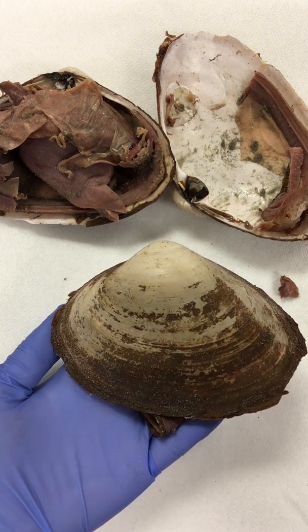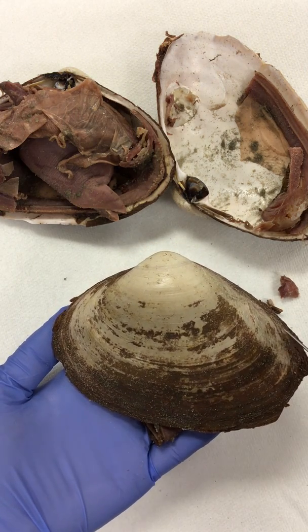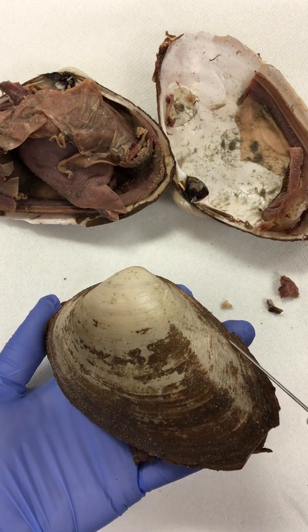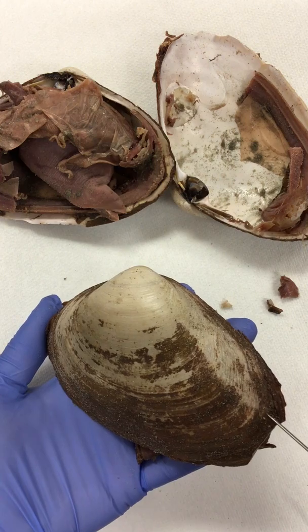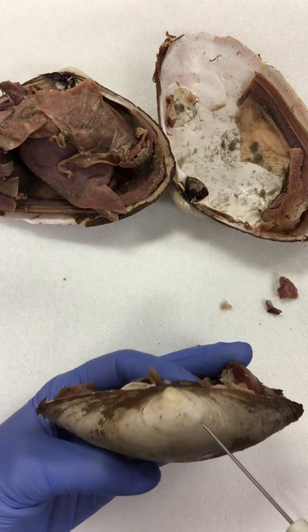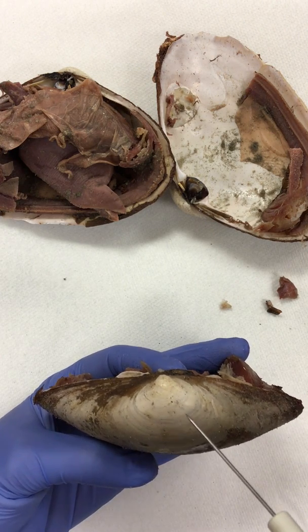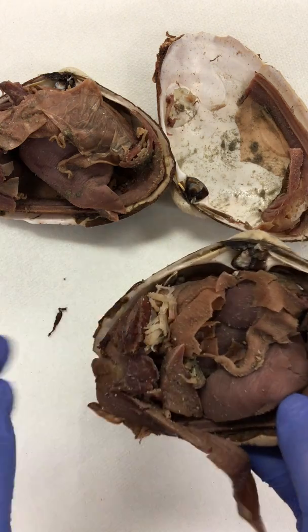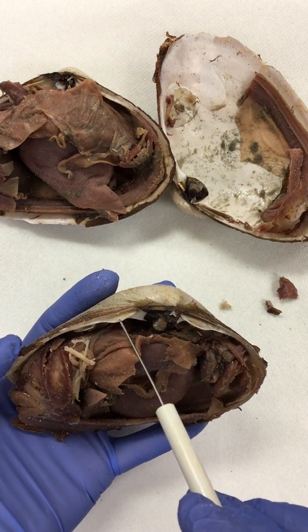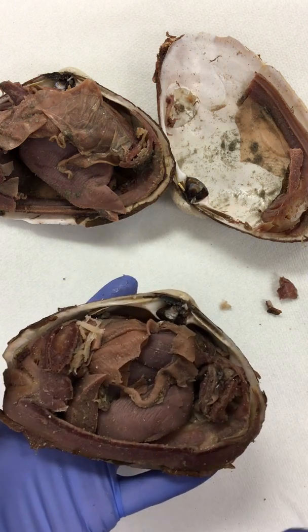When you get inside, you can make reference to some of the anatomical structures that will help you with your positioning or orientation. You can also see that there are some lines on here, and these deep grooves indicate how old the clam actually is, and these are called growth rings. Remember, these are bivalves, so bi means two and valve means shell, and this little region right here is where the embryonic shell actually exists. So this clam has already been opened up and dissected, and what we can see here are these ridges, and these are our pseudo-cardinal teeth. They help to seal the clam and get a good seal on it.